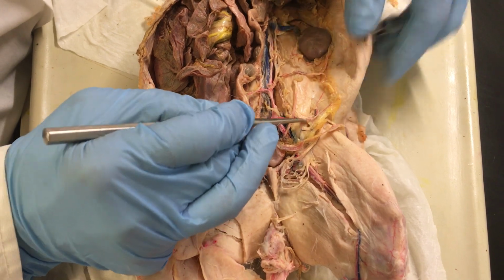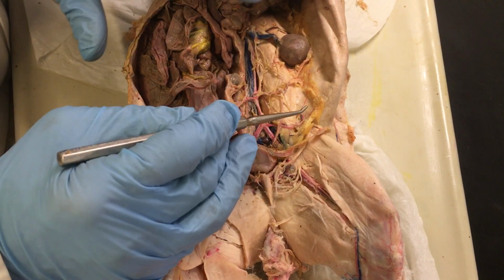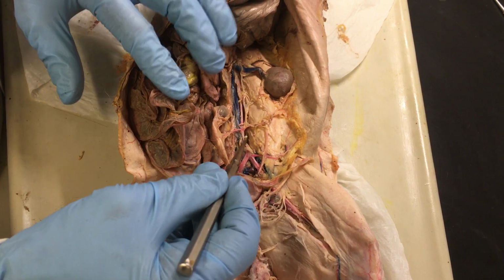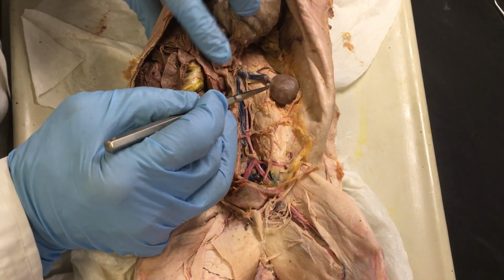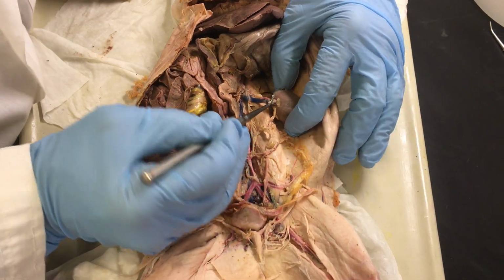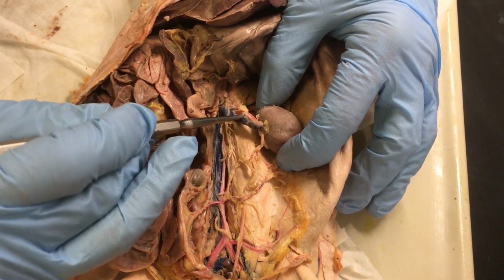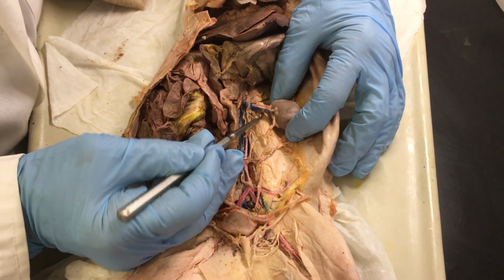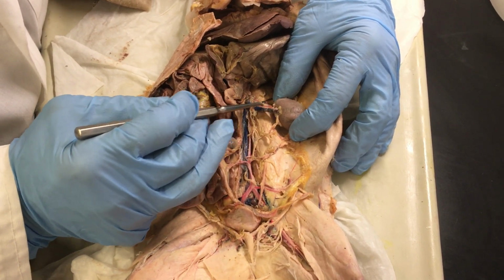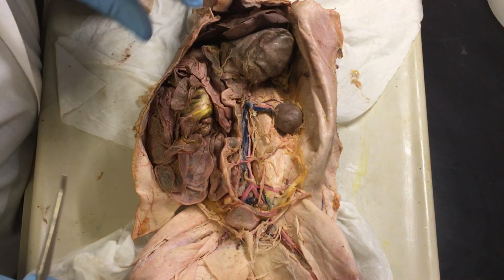There will also, of course, be branching of the aorta that go to the gonads as well, but they're not visible here. You just need to be aware that there are also gonadal arteries and veins. As far as the kidney, you can see very clearly here, the kidney also receives blood via the renal artery, which is the red one here, and then the other vessel, the blue, which would be the renal vein. So the renal vein and artery here are the vessels that connect the two major vessels to the kidney.